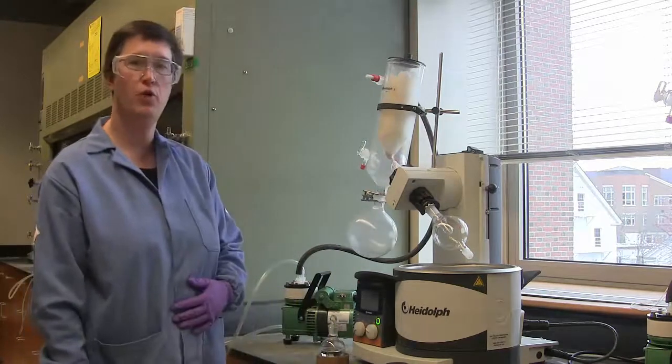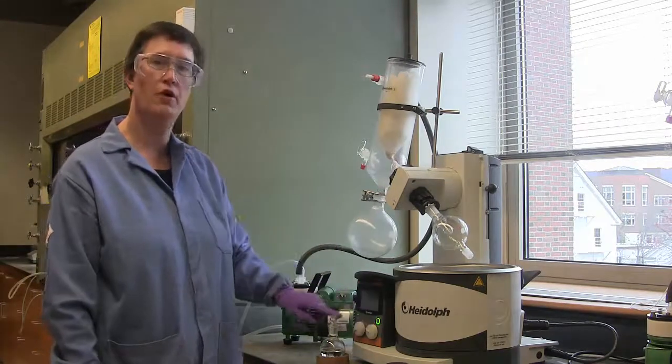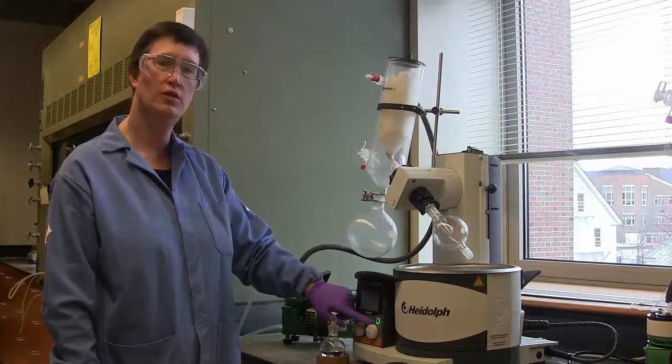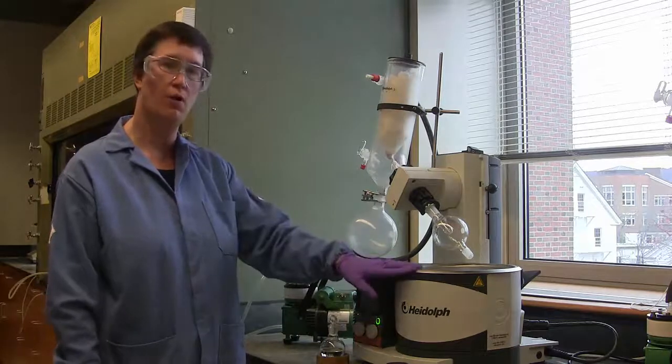Looking at the features of the rotary evaporator, there are two knobs in the front. One controls spinning. We'll put that into action in a few minutes. And one controls the temperature of a hot water bath.